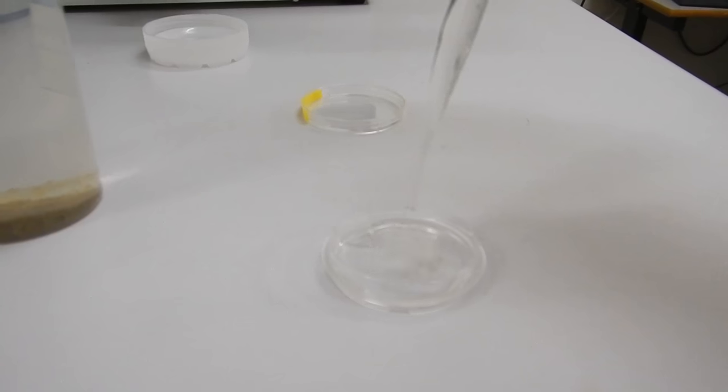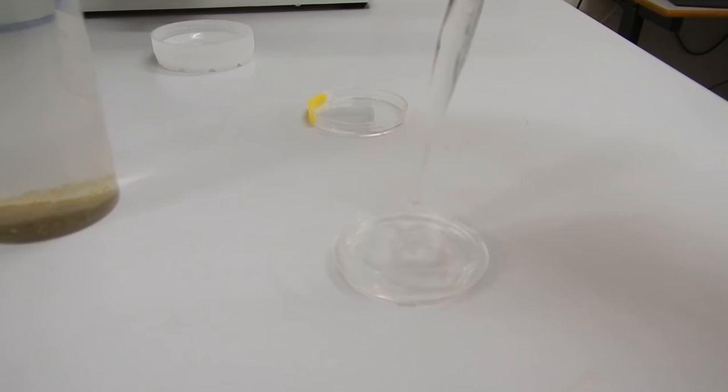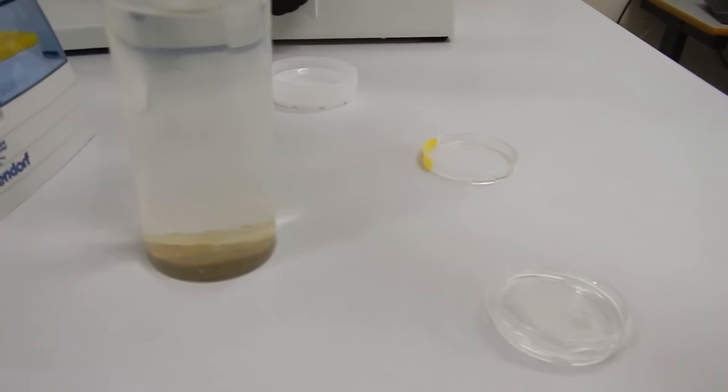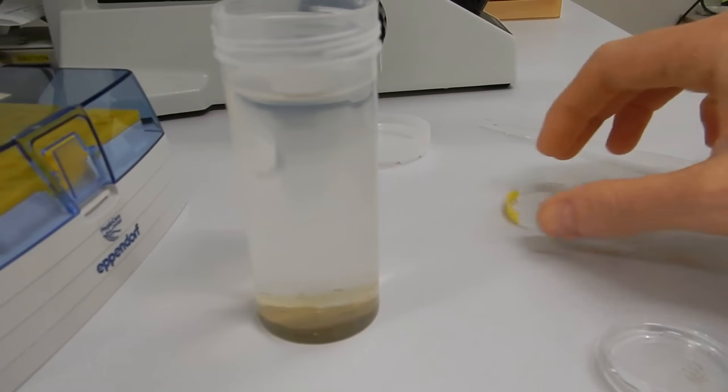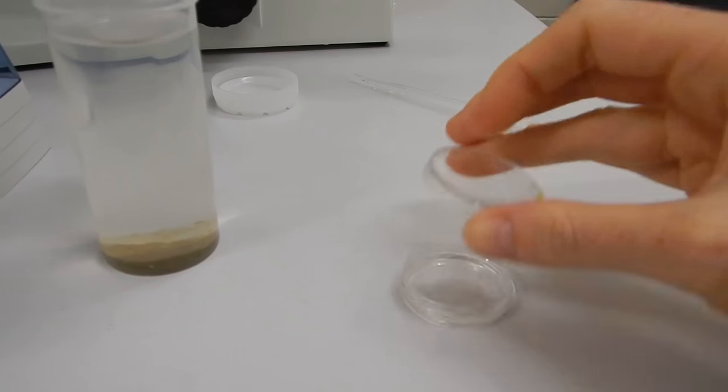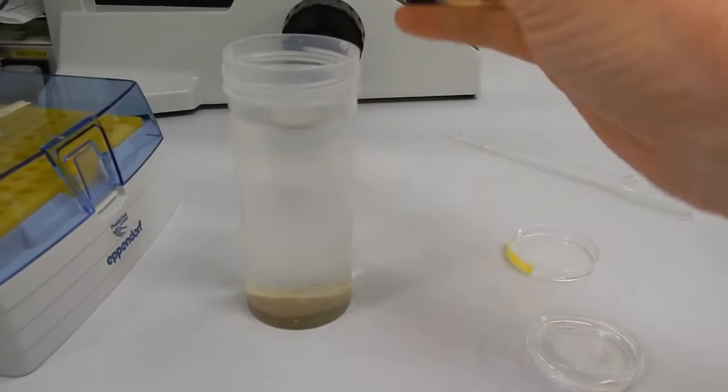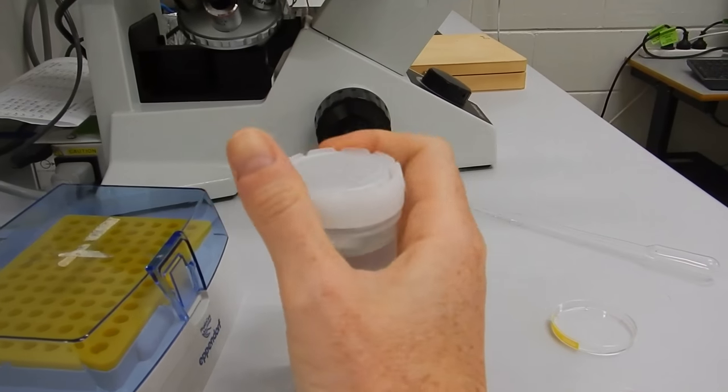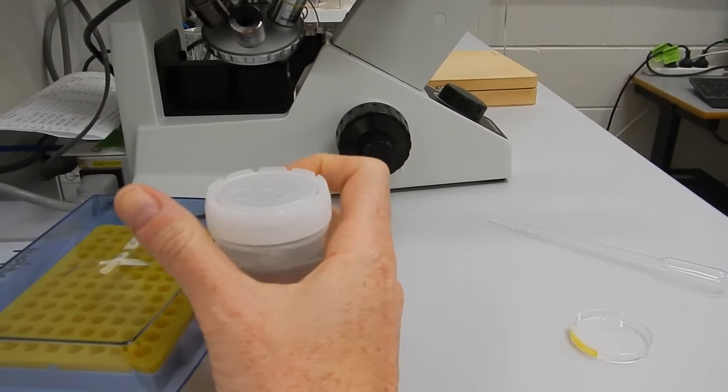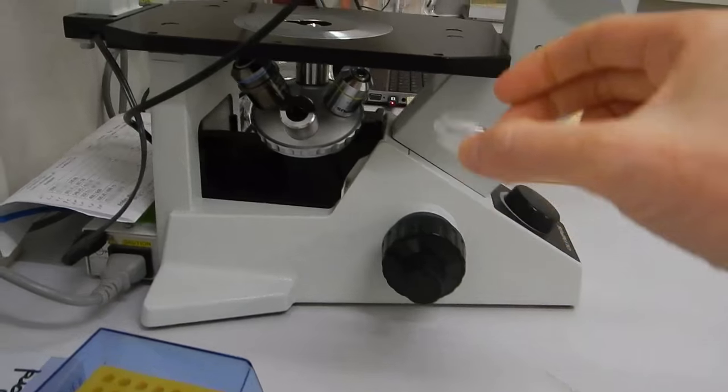I'll insert it into that culture dish. I already had a little bit in there, but I'm just adding more. We don't need to put a lid on the dish, but we need to put this lid back on the container so I don't knock it over by accident.